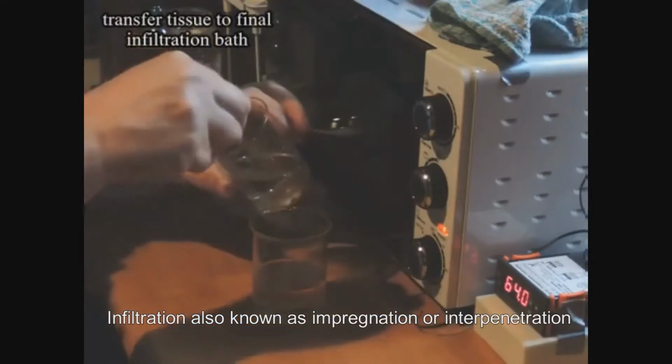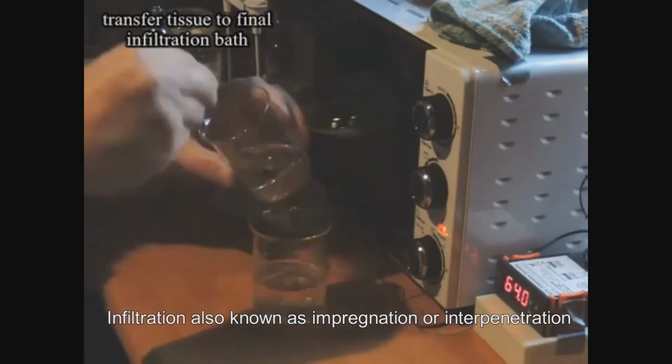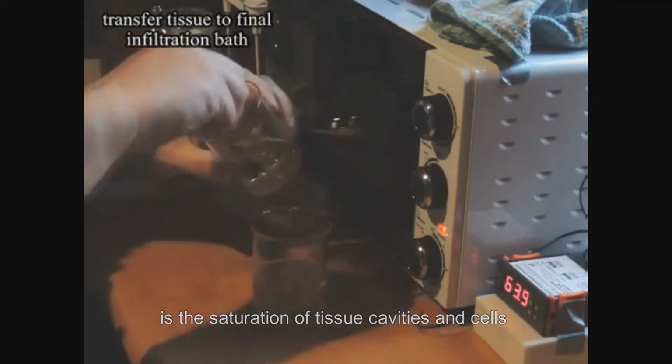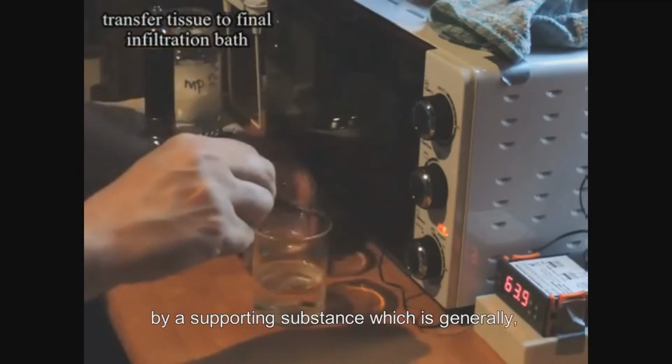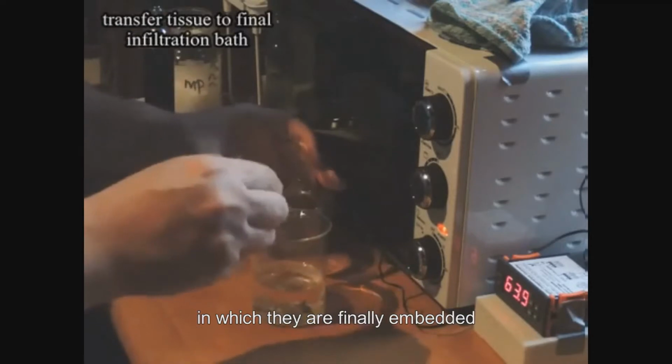Infiltration. Infiltration, also known as impregnation or interpenetration, is the saturation of tissue cavities and cells by a supporting substance, which is generally, but not always, the medium in which they are finally embedded.